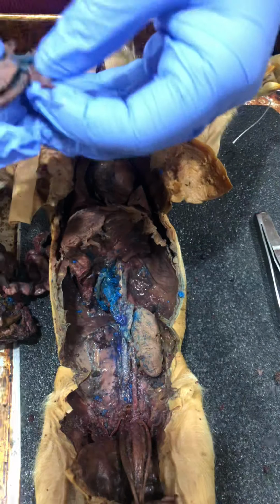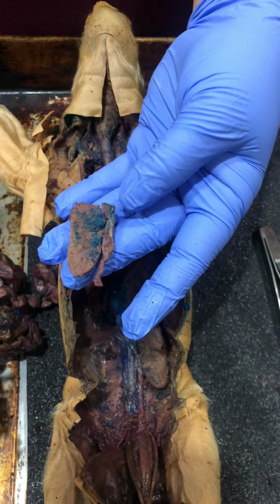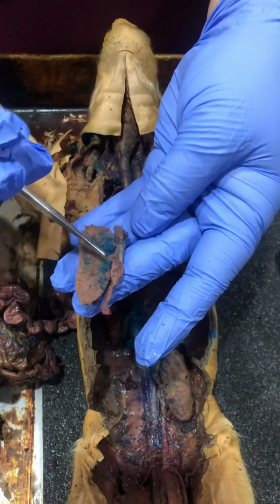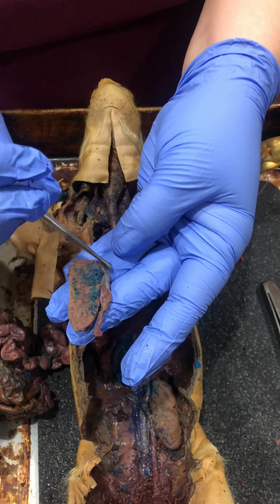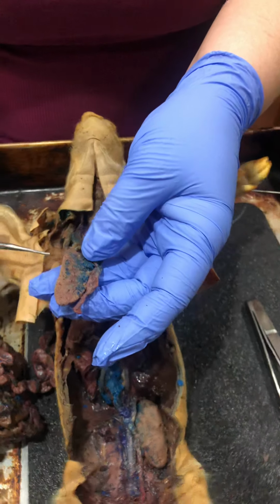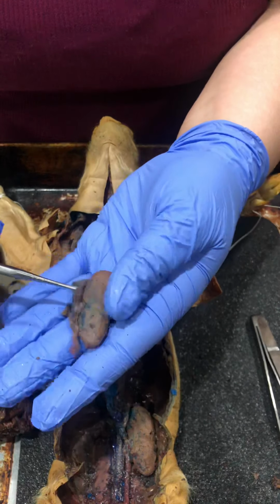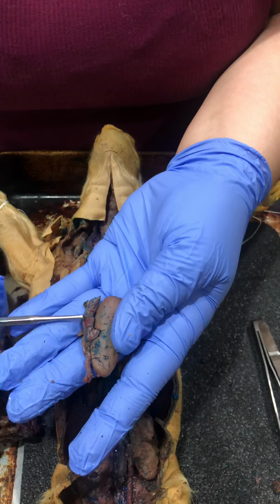So this is the cut of the right kidney. I'm gonna go ahead and take this top part. I want to show you the inside of it. Right here you can see the dye again. Here is the renal vein. And then on this aspect you couldn't really see the renal artery, but if you flip it, right there you can see the renal artery. You can tell by the blood tinge right there, renal artery.